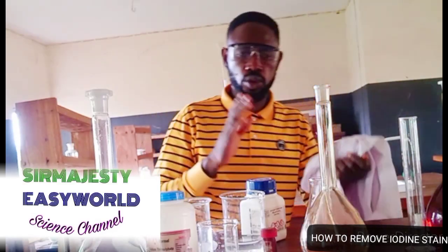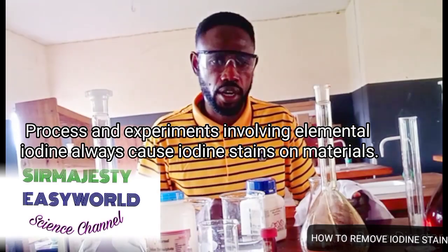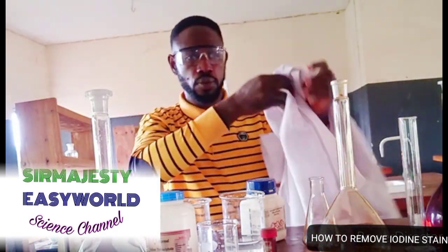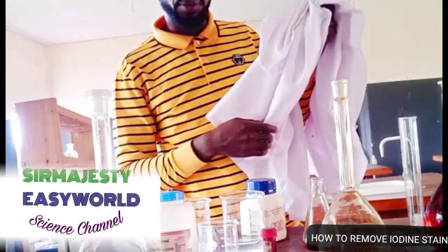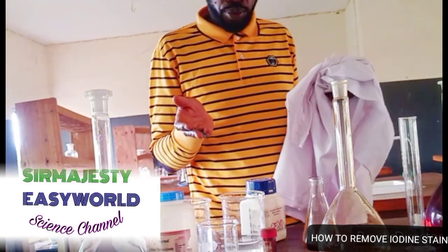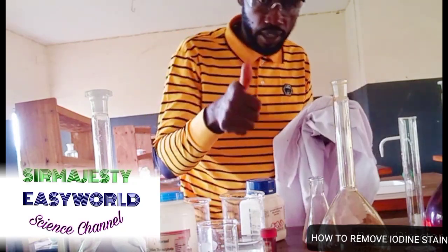Okay, alright. See, there is a problem with titration involving the use of iodine. Stains everywhere. As you can see, washing it off becomes difficult. Even when it pours on your clothes, or on your lab coat or your student's lab coat, how can you handle it? How do you remove it? Simple. The best way to remove the iodine stain is by, let's take a break.